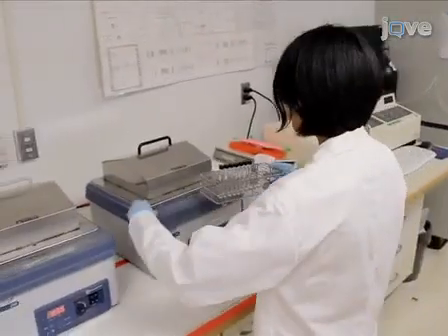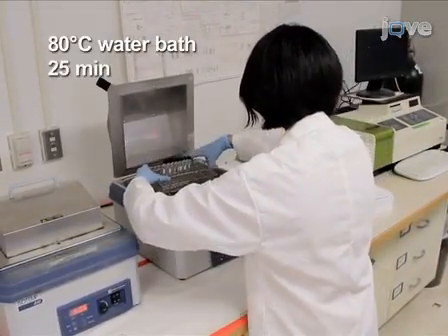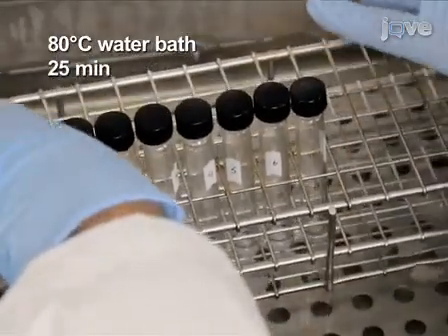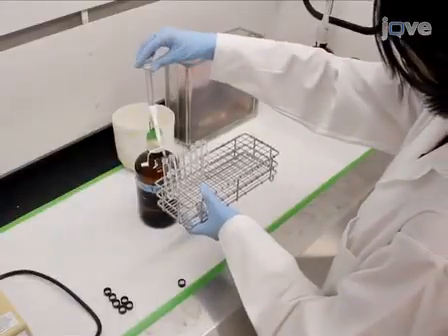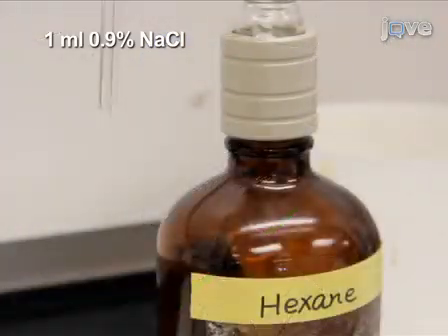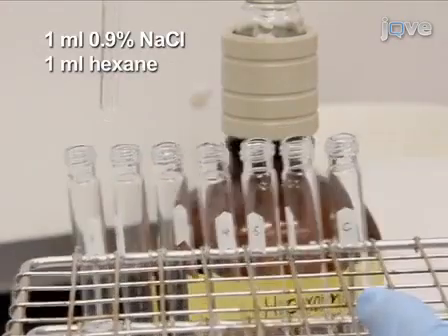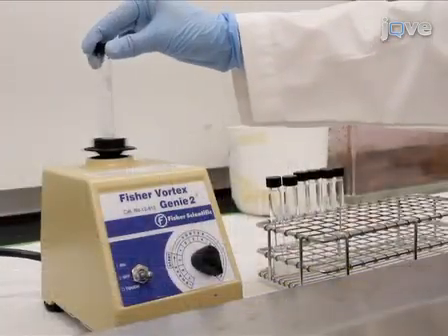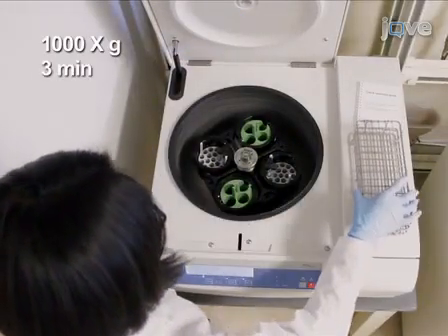Incubate the glass tubes in an 80 degrees Celsius water bath for 25 minutes. Tubes must be sealed so that the solvent does not evaporate. After tubes have cooled down, add 1 ml of 0.9% sodium chloride, followed by 1 ml of hexane, and then vortex vigorously. Centrifuge the samples at 1000 times g for 3 minutes.